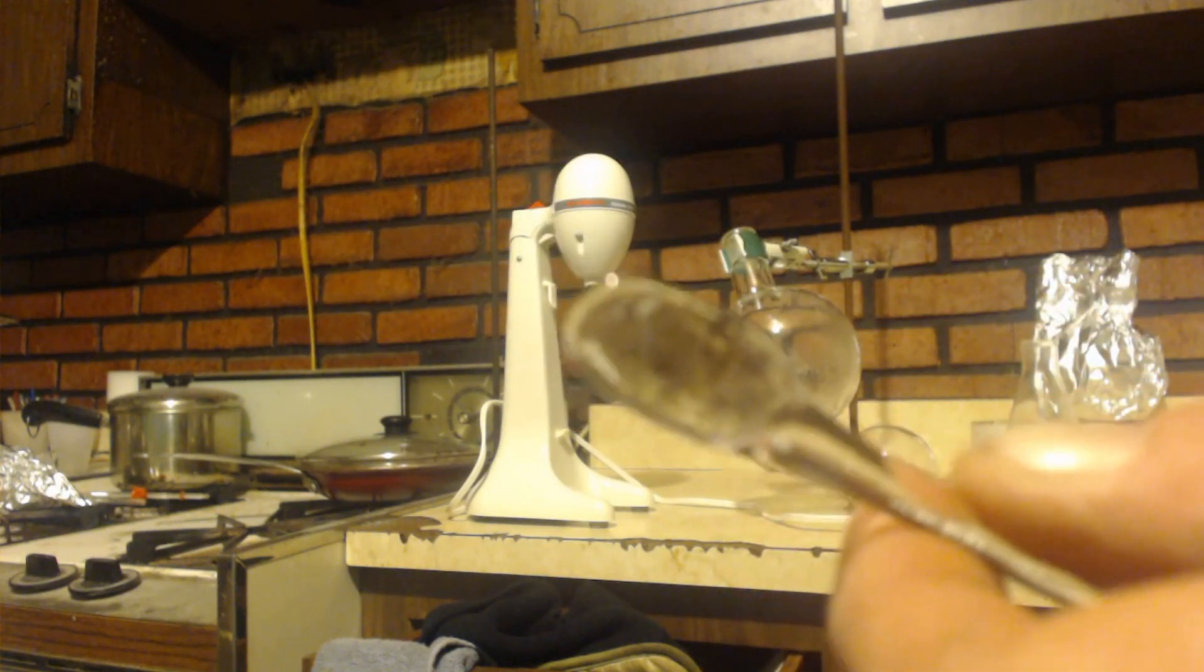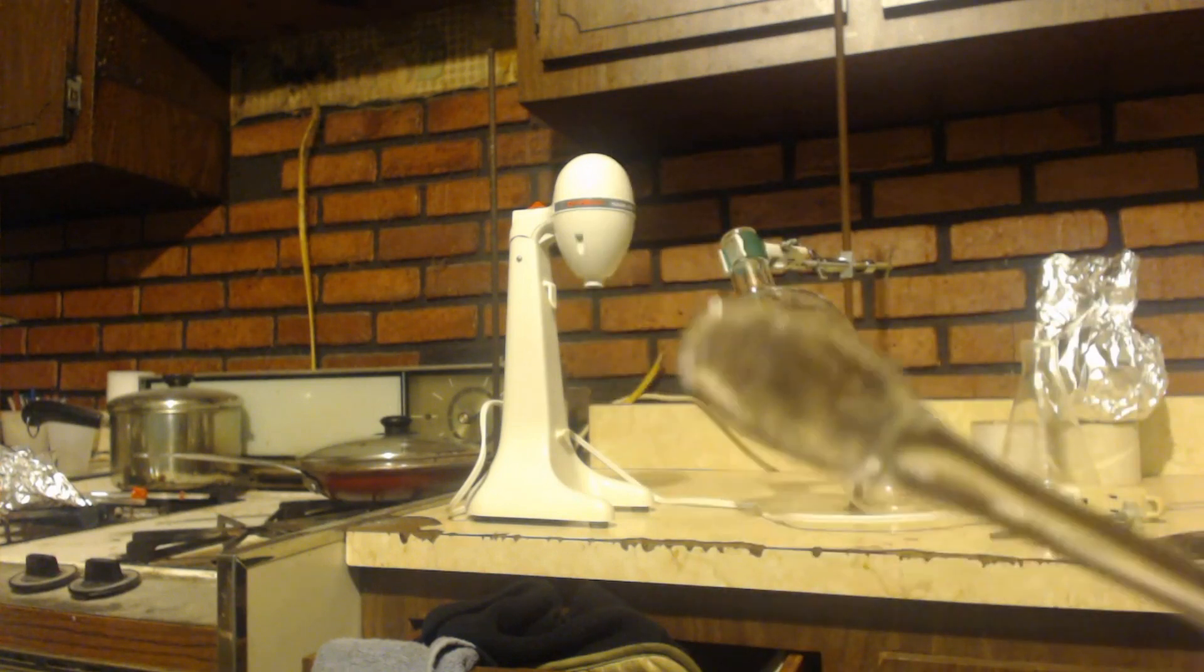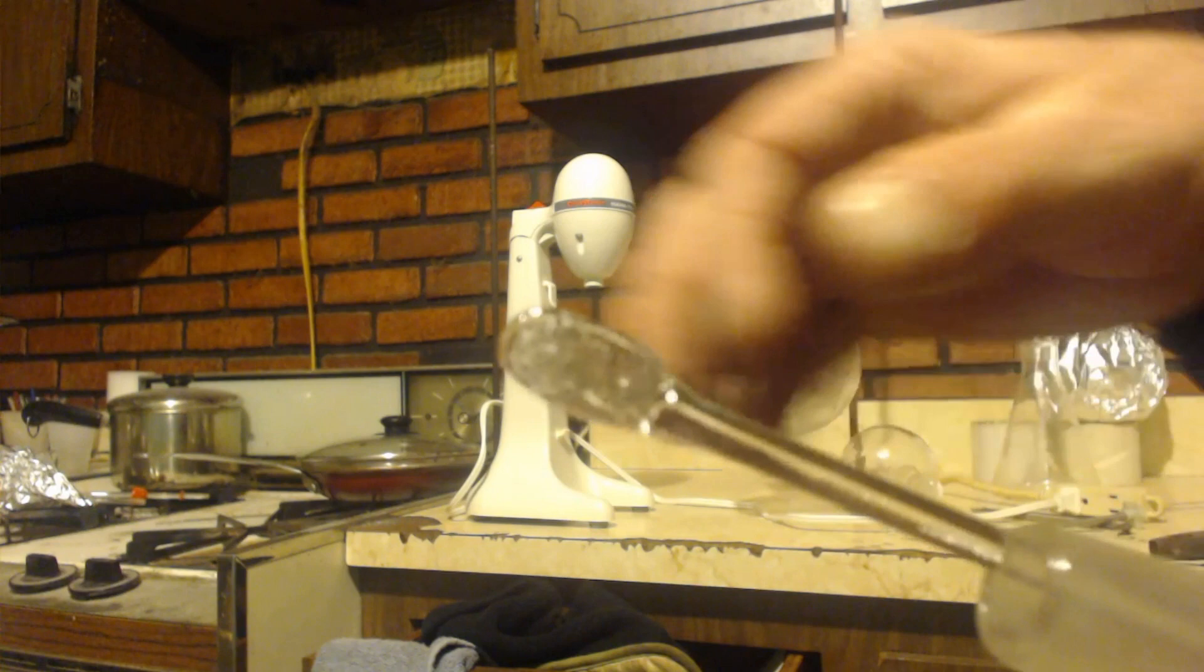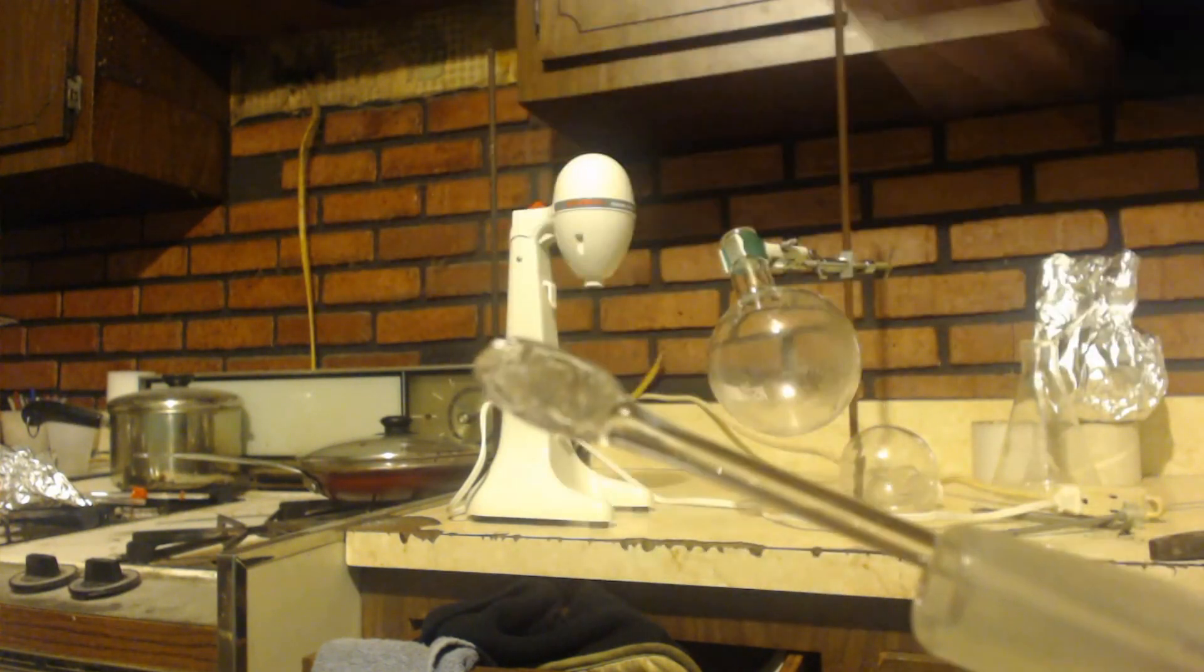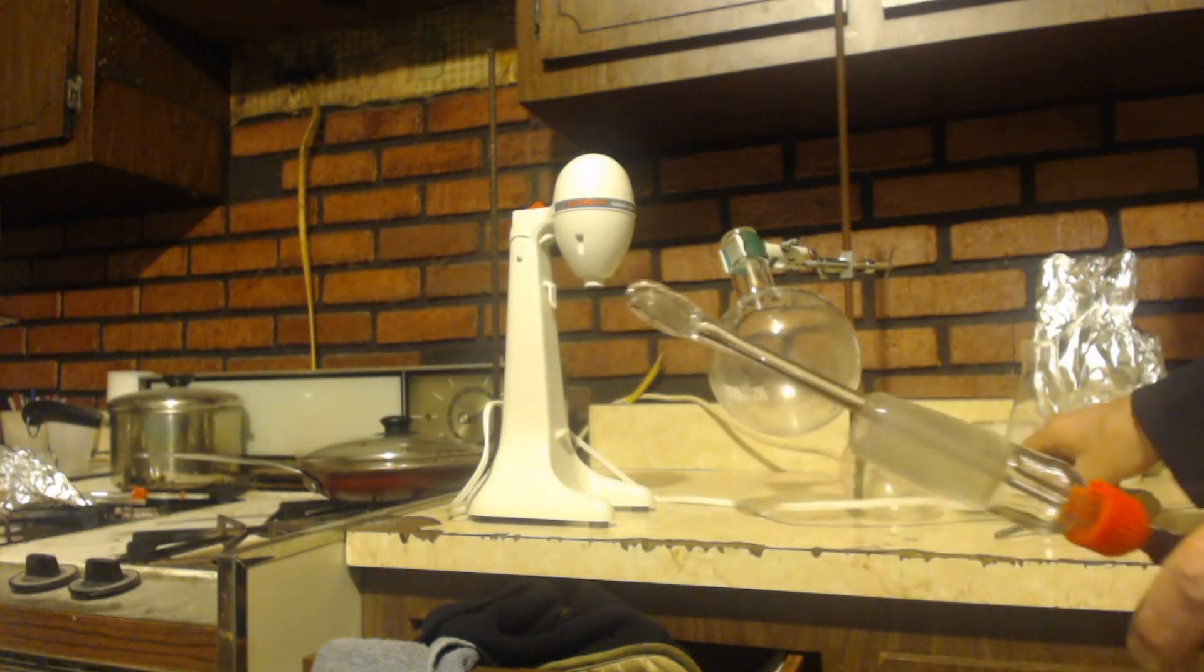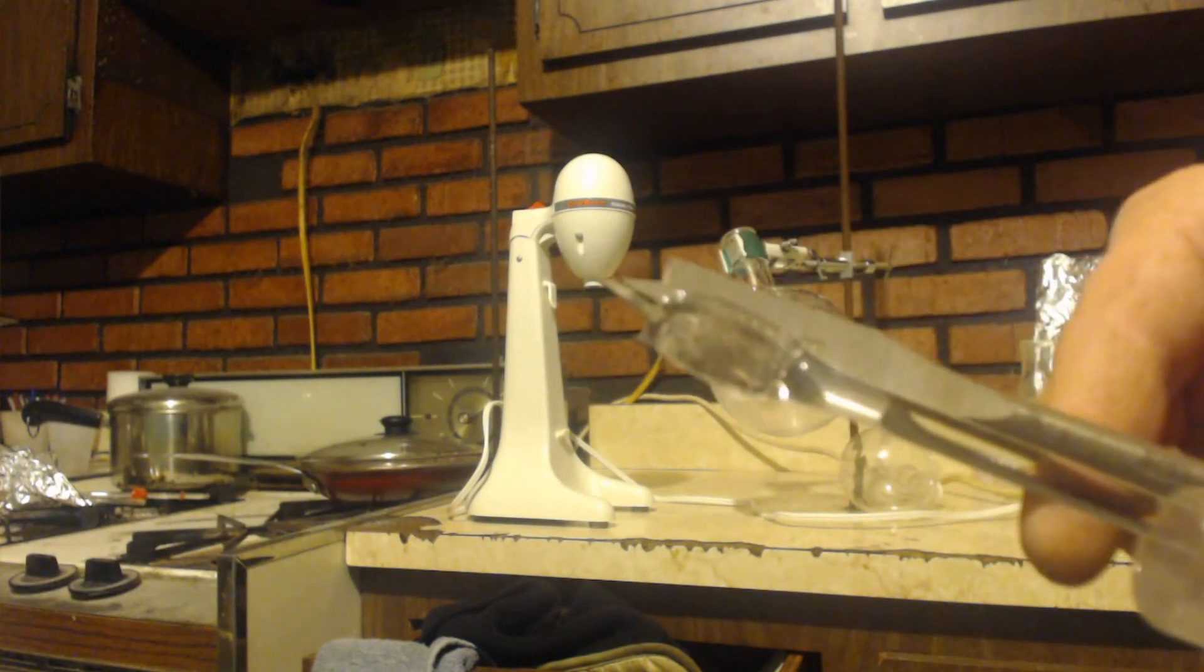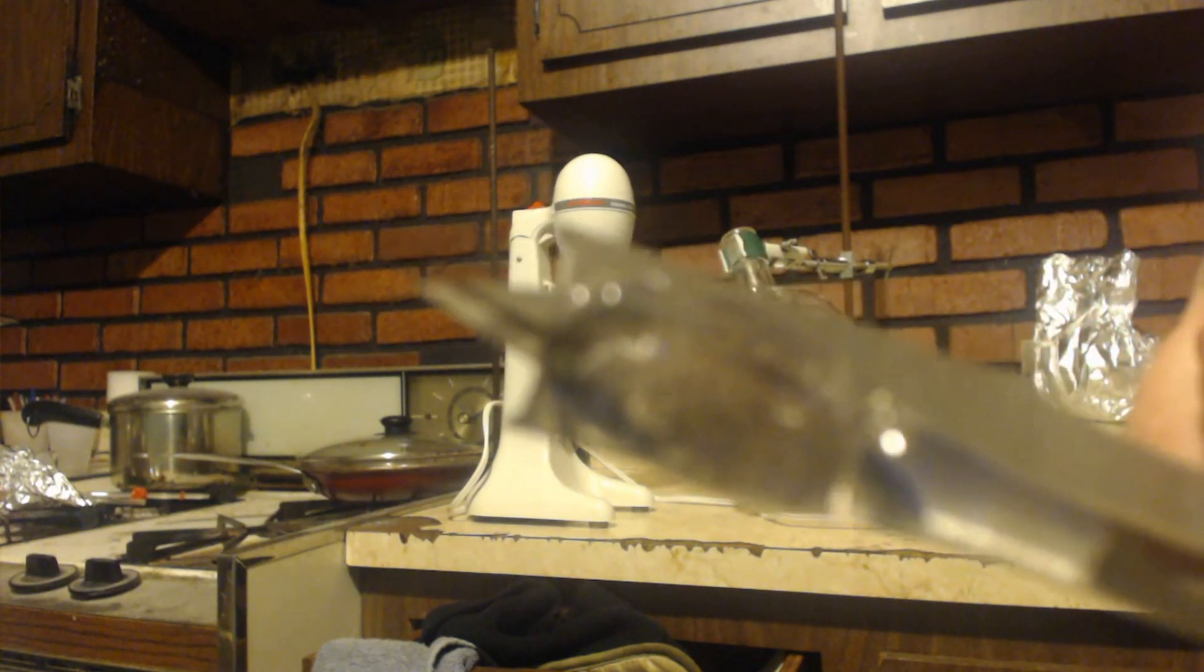It's kind of black because from my dirty pliers. Now that's even smaller than I needed. I actually would have had to flip this a second time and squeeze it so I could fan it out more.